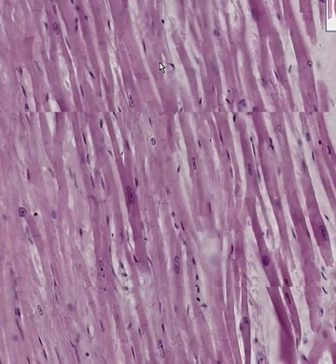So cardiac muscle is also striated, not as nicely striated as skeletal muscle, but it has the nuclei in the middle of the fiber. It has intercalated discs. The fibers branch to connect with adjacent fibers because the method of contraction is not linear, it's in multiple dimensions. And last but not least, the fiber is not quite as thick as the skeletal muscle voluntary striated fiber. They're a little bit smaller.